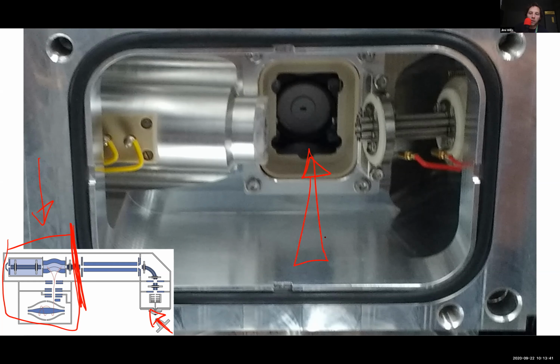So the ions come out of the quadrupole, whether they've been filtered or not, and they go into a component that's normally in this space here called a C-trap. And it's like a bucket. You have a continuous stream of ions coming in, you fill the bucket. When the bucket's full, you empty it into the mass analyzer. And the mass analyzer is back here. It's called an Orbitrap. We'll come on to that. I don't know if you can maybe see there's a tiny little hole in the front there.